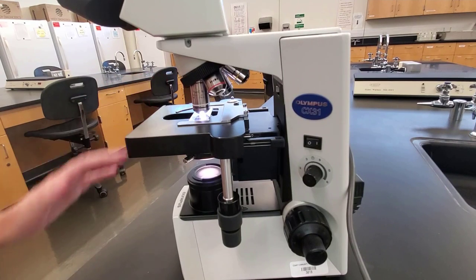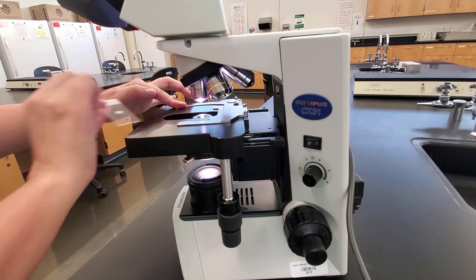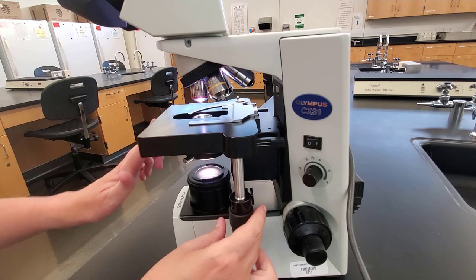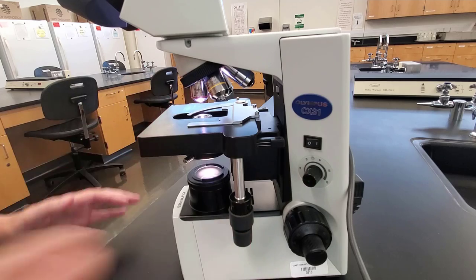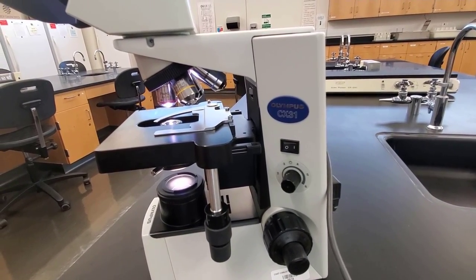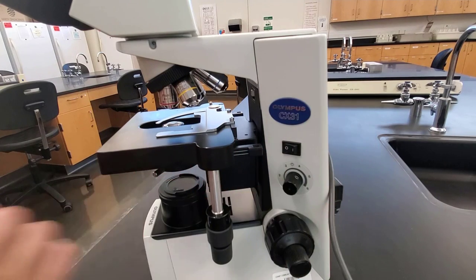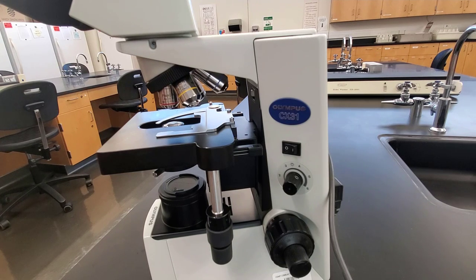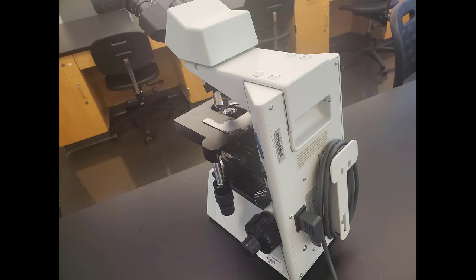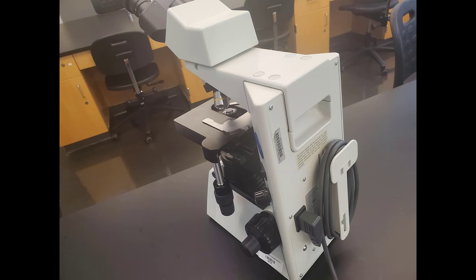To put the microscope away, start by rotating the smallest lens — the 4x — into place, then remove the slide from the stage. Make sure the stage is flush and not hanging over in any direction, and that the stage clips are aligned. Then turn your light intensity all the way down, and after that turn off the microscope. Turning the light down before powering off prevents the lamp from surging on next time and potentially blowing a fuse. Finally, wrap the cord around the back of the microscope and put it away in the cabinet. That concludes this lab.